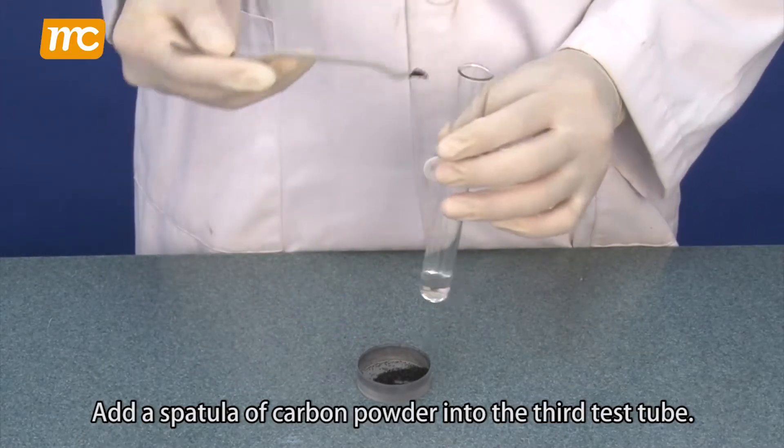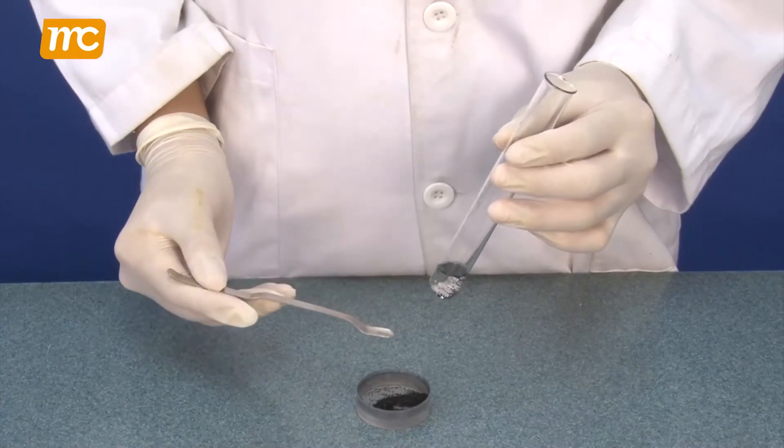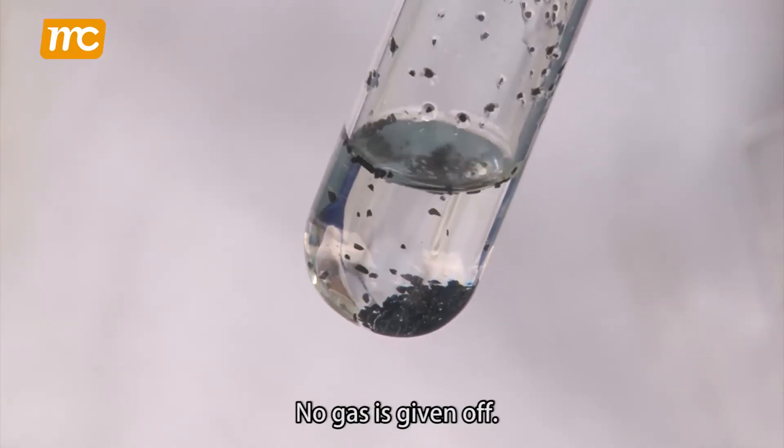Add a spatula of carbon powder into the third test tube. No gas is given off.